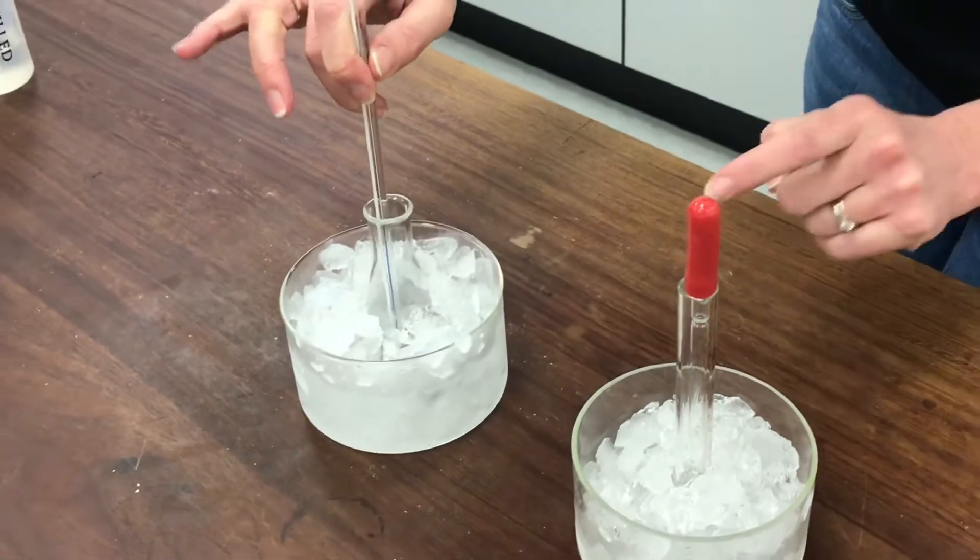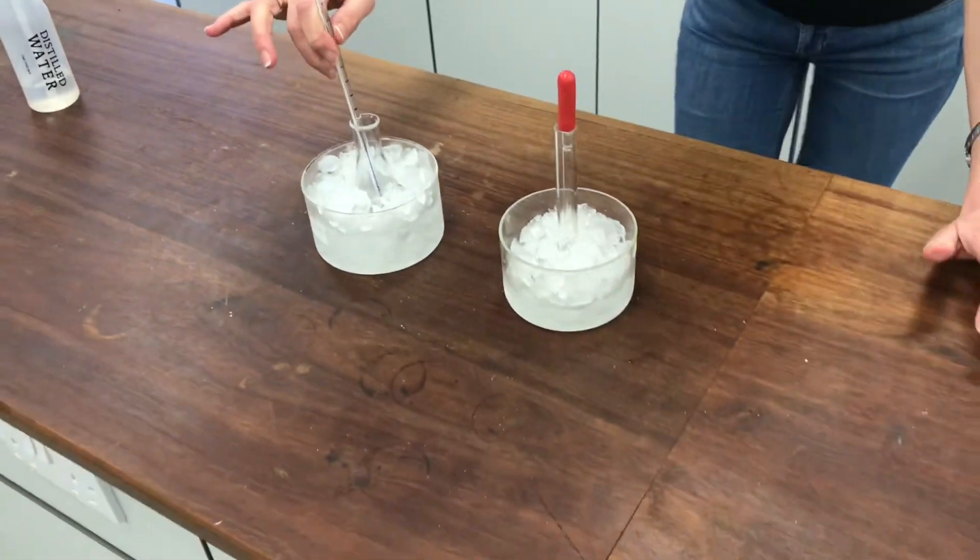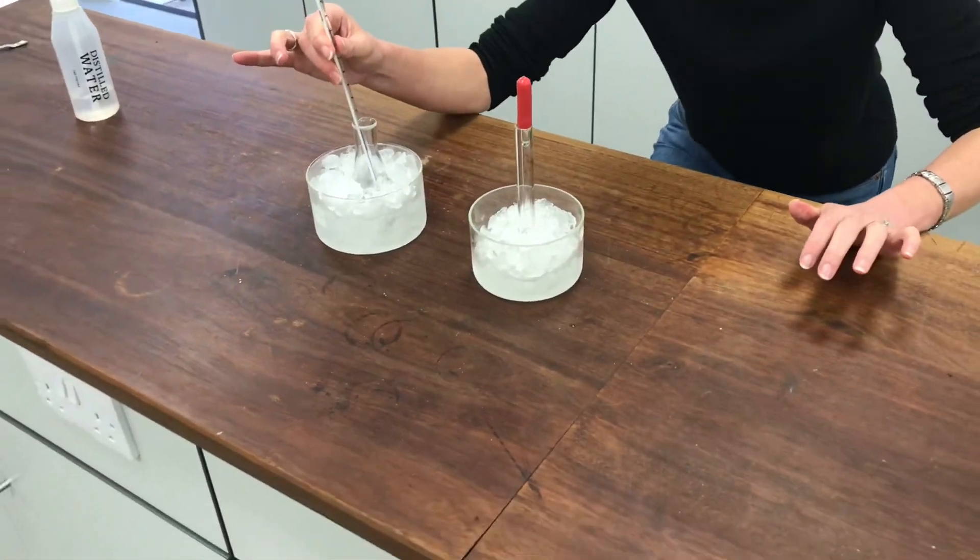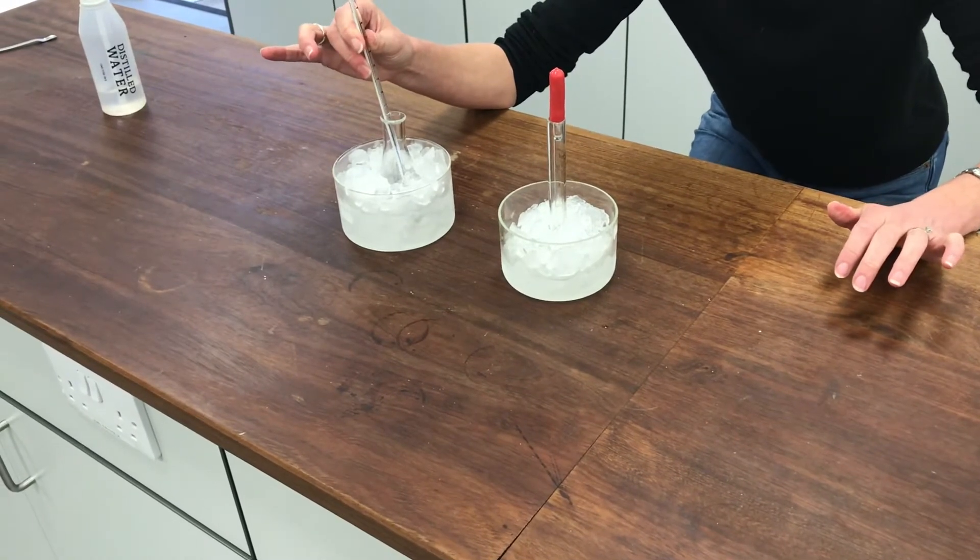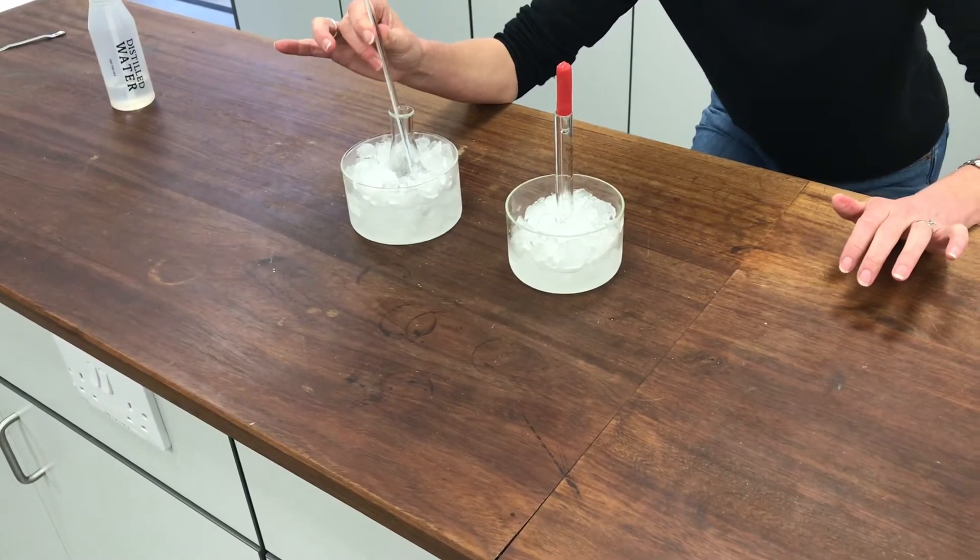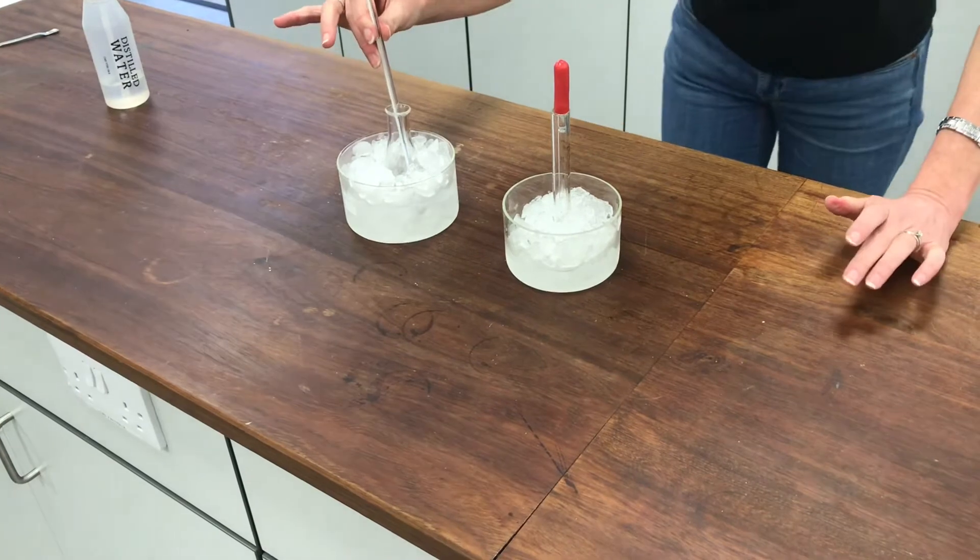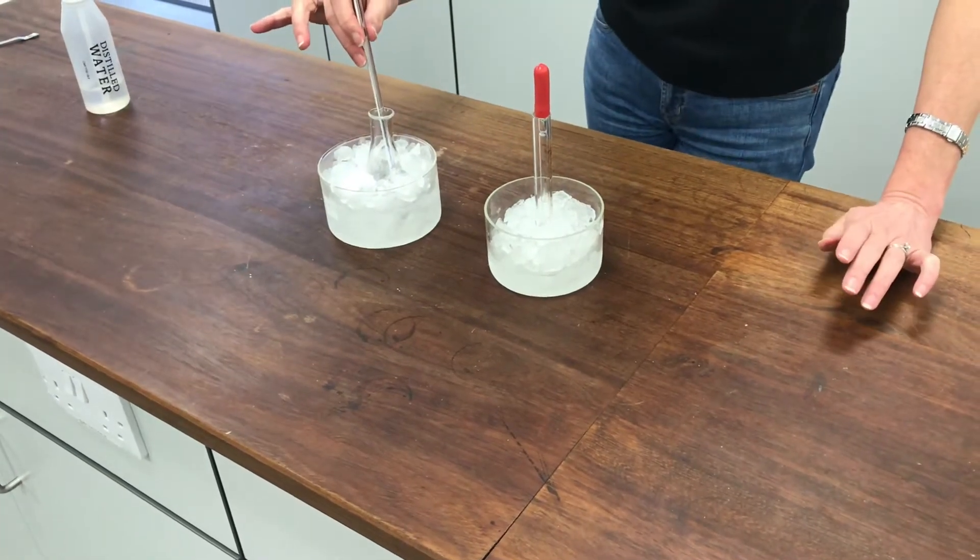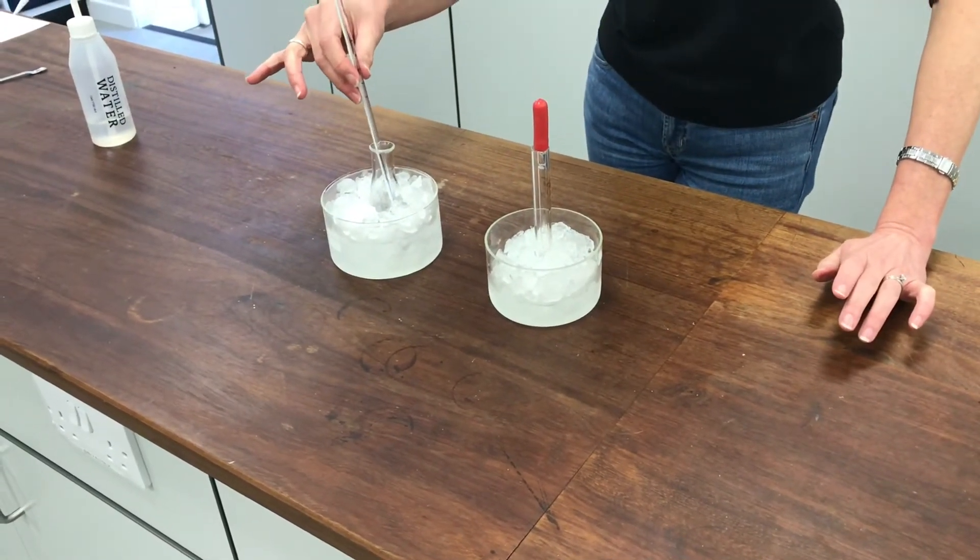It's going to take quite a while to add all of my nitrating mixture, all 4 cubic centimeters of it, to my reaction in my conical flask here. So it's going to be very slow. So I think I'll do that and then I'll join you later when I've nearly finished.